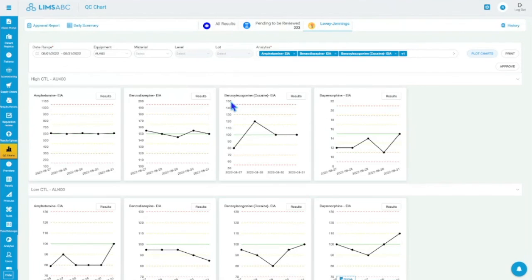We need to add a few qualitative results to be able to show that as well. We do support qualitative, expected result, negative, positive. So we do support that, obviously, because you're not always going to get a number for your QC results.